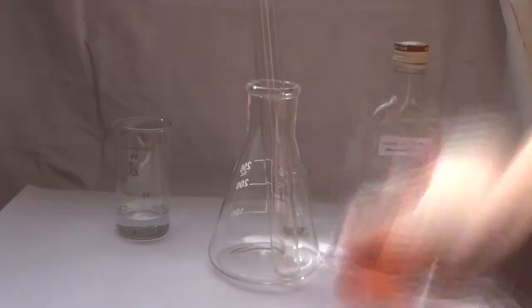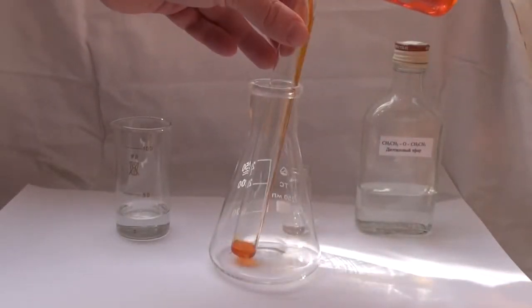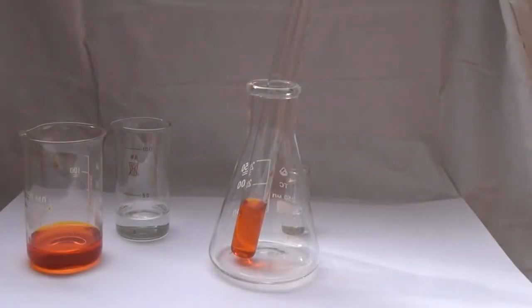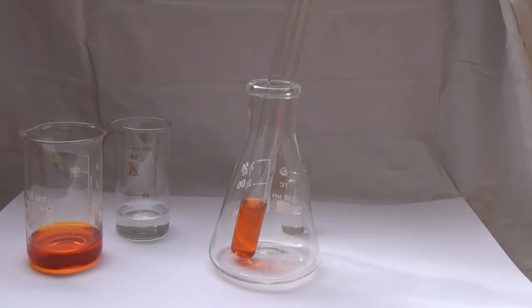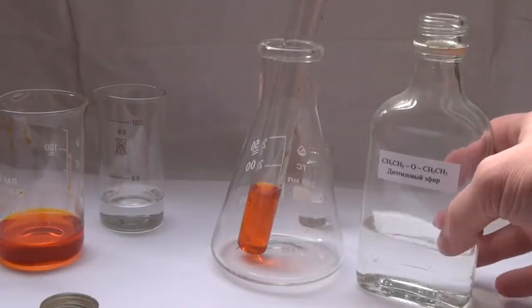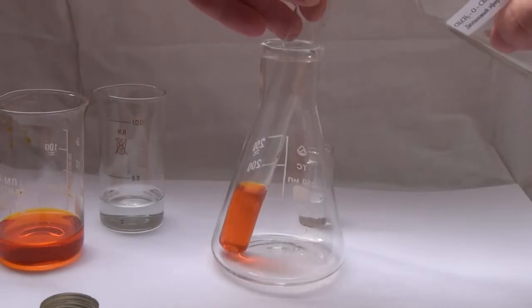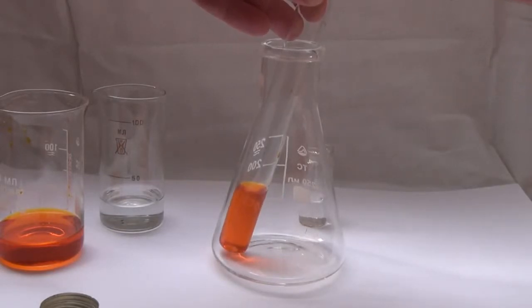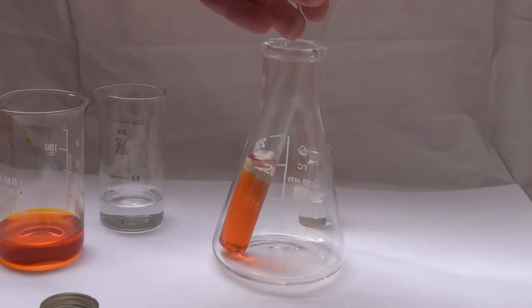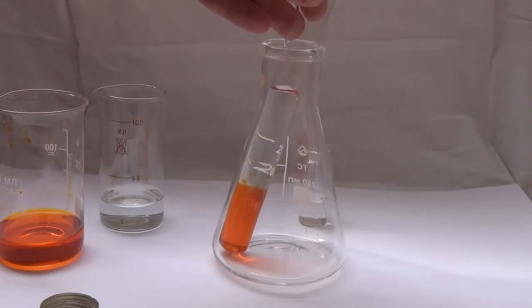To conduct this experiment, we will need a solution of potassium dichromate, which I pour into the test tube. Let's pour a small amount of liquid. Next, we will need diethyl ether. Diethyl ether has a low density, so it will float on the surface of the potassium dichromate solution.